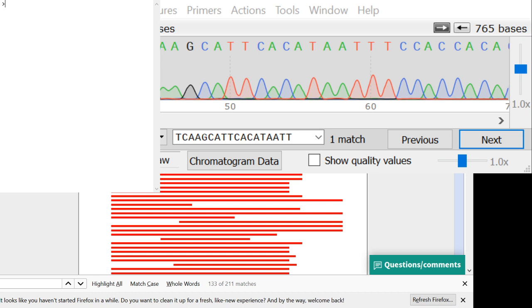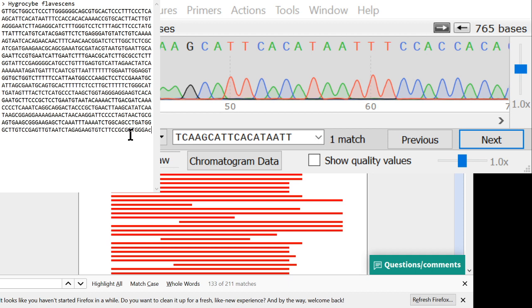FASTA always starts out with a caret like that, and then we give it a name. The name doesn't really matter very much if we're submitting just one sequence to GenBank. If we're submitting a whole bunch of sequences at once, which is a good idea if you have a lot of sequences, then the name does matter. But for now it doesn't matter what we type here, though we do have to type a name. It has to be something. So Hygrocybe flavescens, and then you hit enter, and on the next line you paste the actual sequence. And there's the actual sequence. Now we have a valid FASTA file, and if we wanted to, we could type another caret and put another sequence in here. We could put hundreds, even thousands of sequences in here, but we're just going to submit this one sequence to GenBank right now, so we just have this simple FASTA with the name and the sequence.